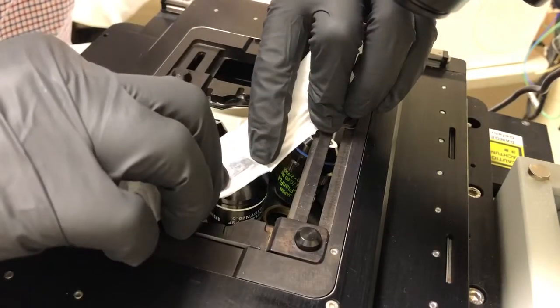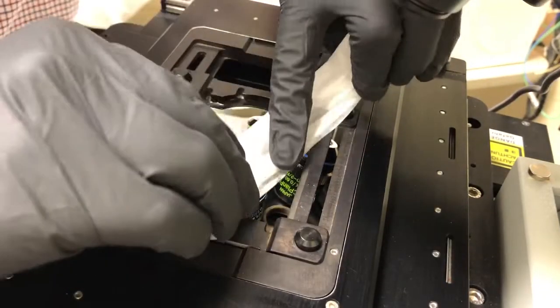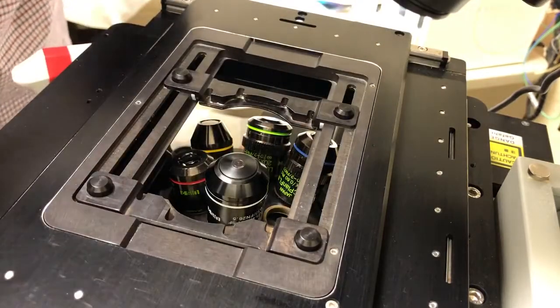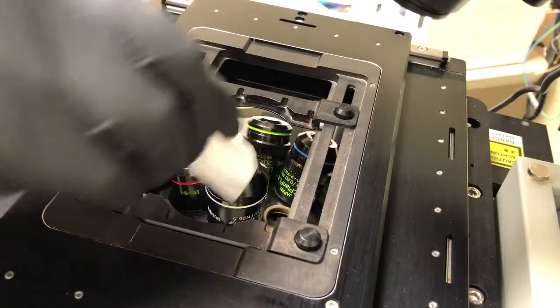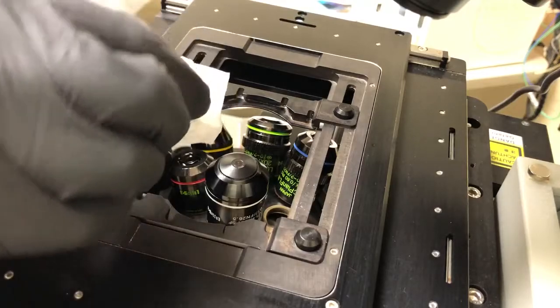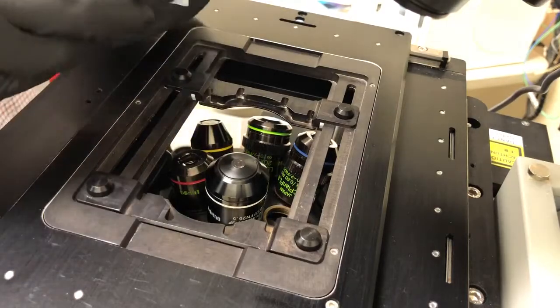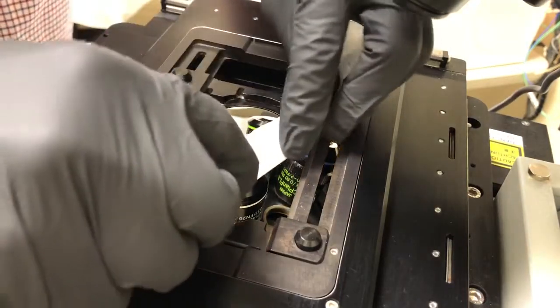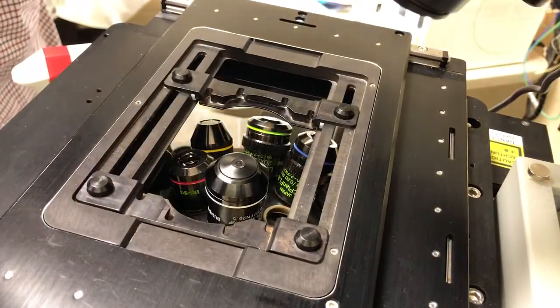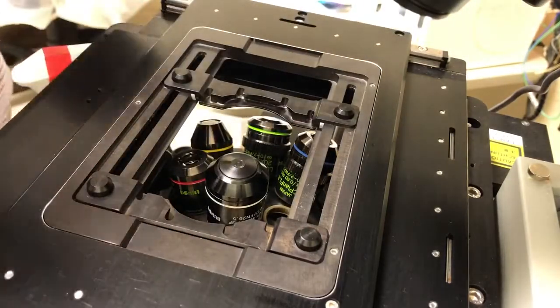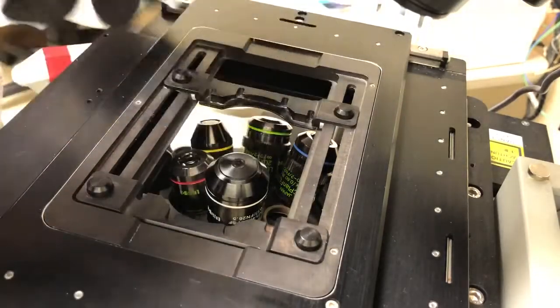You don't want to do this, because if there's a little piece of dust or dirt, by doing this we'll scratch the entire objective, as opposed to swiping it once, where it will cause less damage. It's a safety measure to always just swipe once like that instead of doing this.